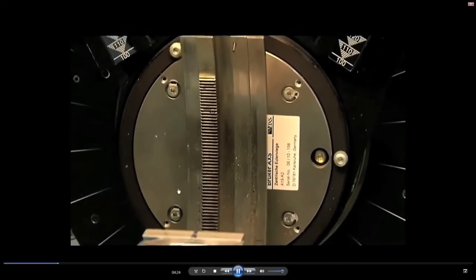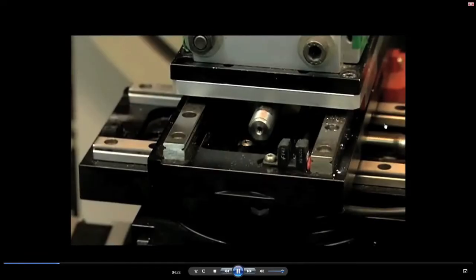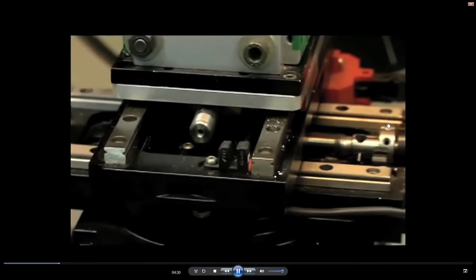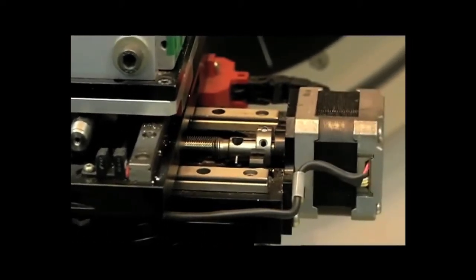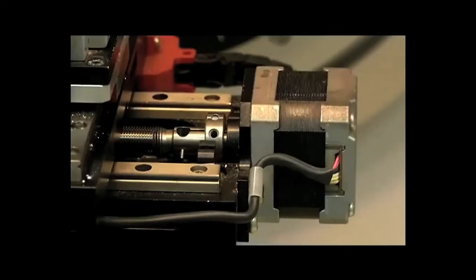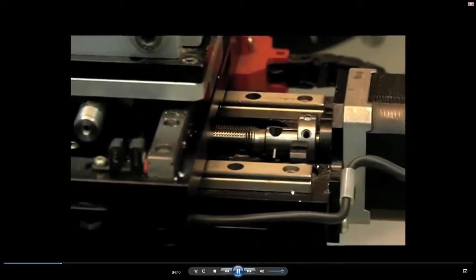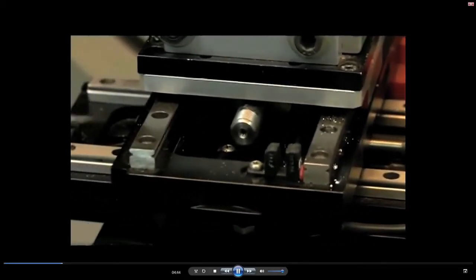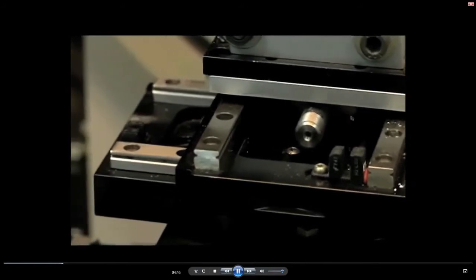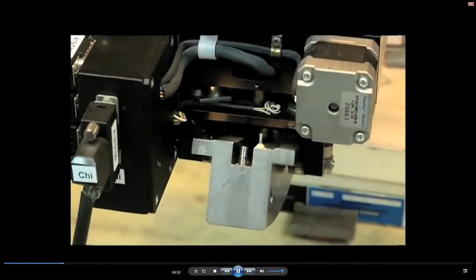You just see that the X-ray source and the detector are going to be on the goniometer circle, or you can say the diffractometer circle. You just observe these details for some clarity. These are all an XY movement for the specimen stage. We will discuss the importance of this movement.